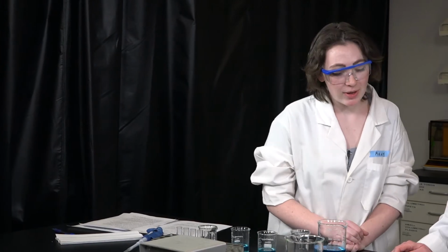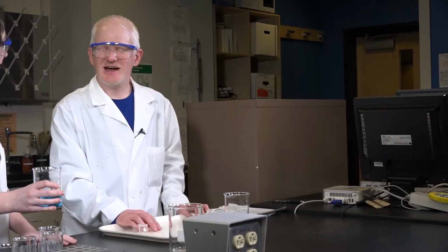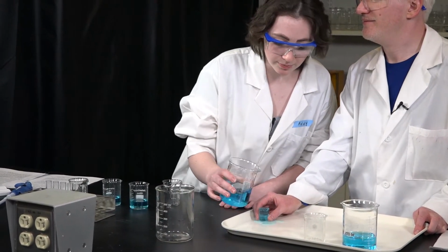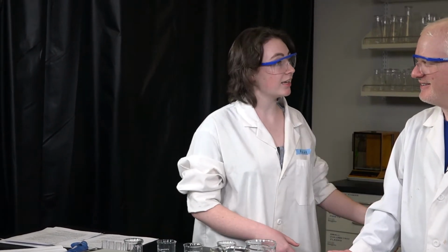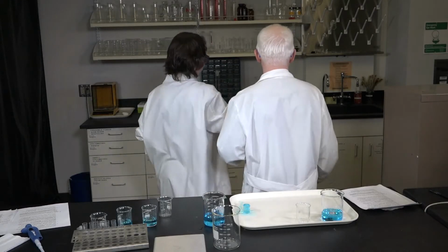Hey, Tom, would you mind holding the small beaker while I pour the liquid into it? It's at 3 o'clock on your tray. Sure, Addie. Thank you. Here you go. Oh, sorry about that. I overflowed it. No problem. Would you like me to show you the sink? Sure. Could you show me your elbow and we'll do sighted guide? Sure. Here you go. Thank you.